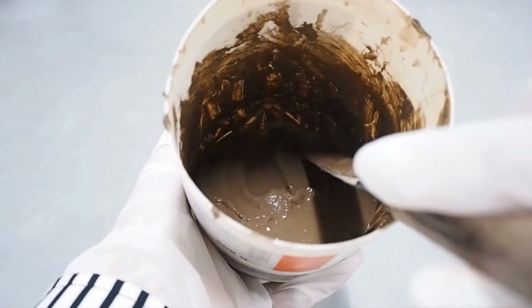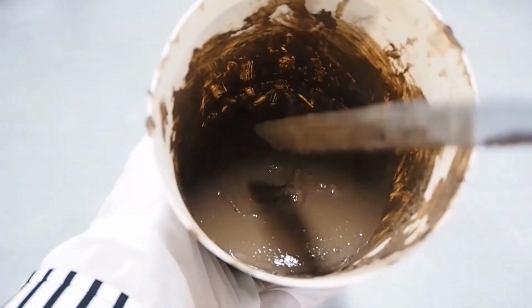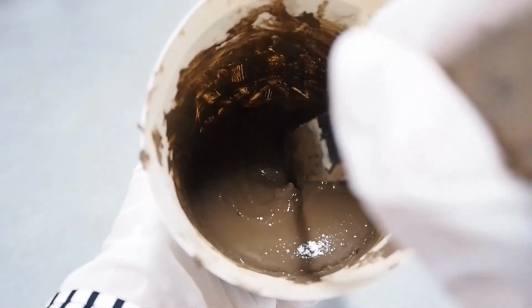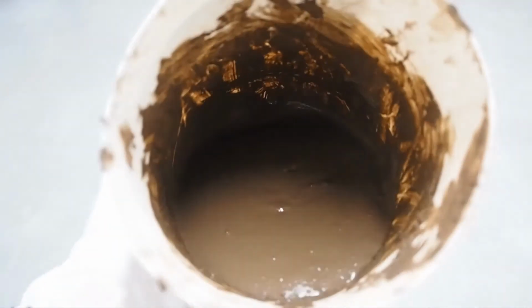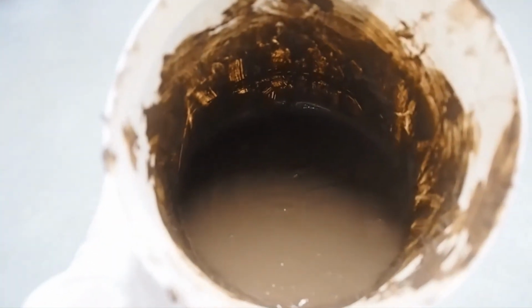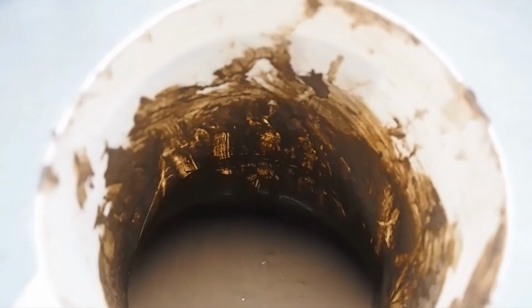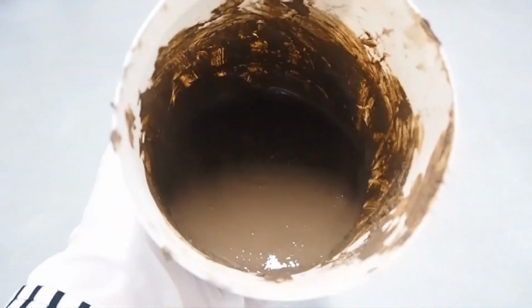At the saturation, the soil paste glistens as it reflects light and flows slightly. And the paste slides freely and cleanly off the spatula for all soil. Now the soil is saturated with water.